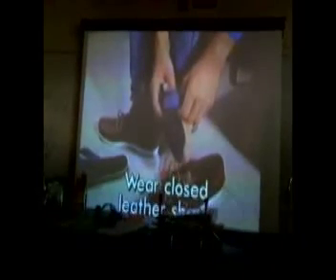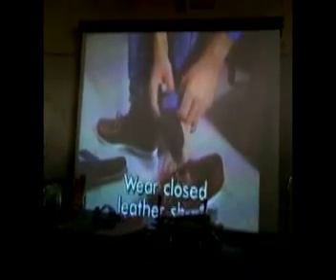Eating and drinking in the lab can cause similar problems. Chemicals can contaminate your food or splash into a drink. Get rid of them before you come into the chemistry lab.